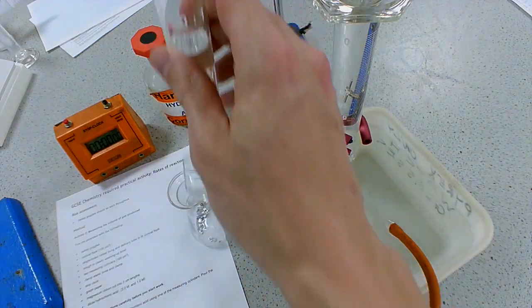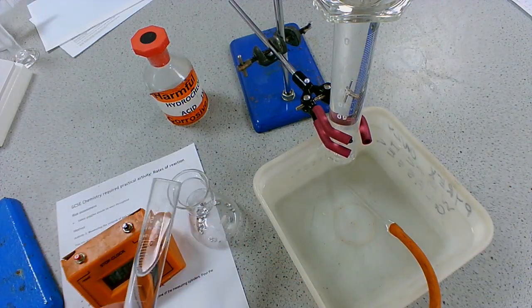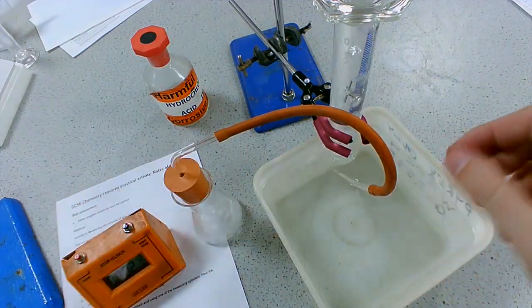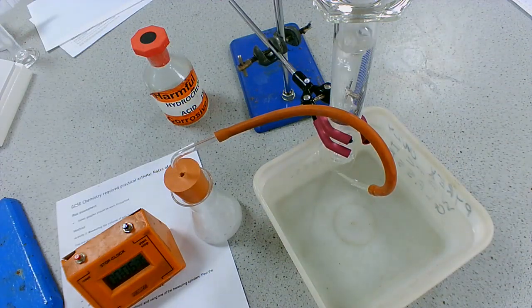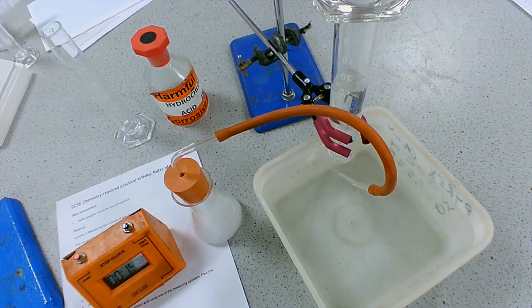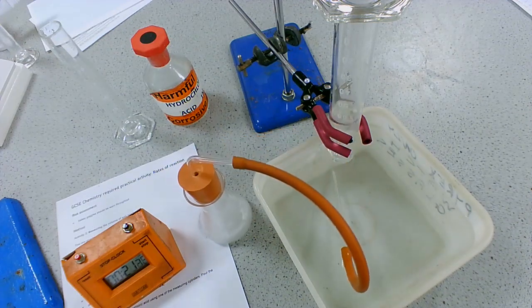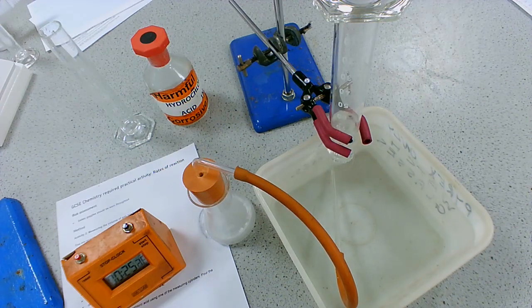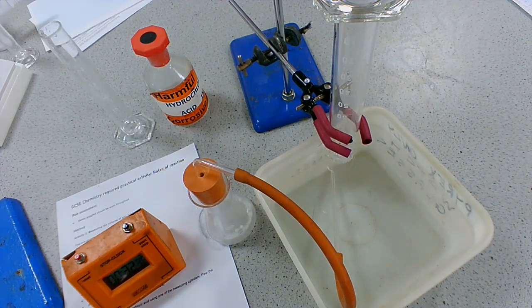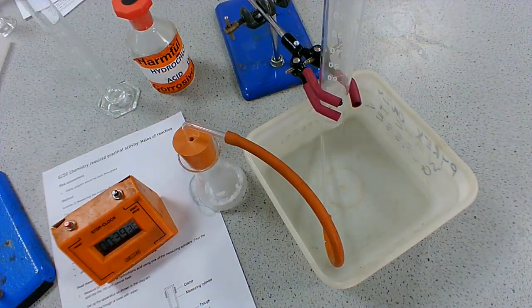Let's have a go. I'm going to get the hydrochloric acid in, bung on, timer started - and you can see the gas being produced. In this experiment, you're going to be recording the volume of gas at regularly timed intervals every 10 seconds. So at 10 seconds it was 30, after 20 seconds it is 55, after 30 seconds it is 85, and at 40 seconds it has reached 100.